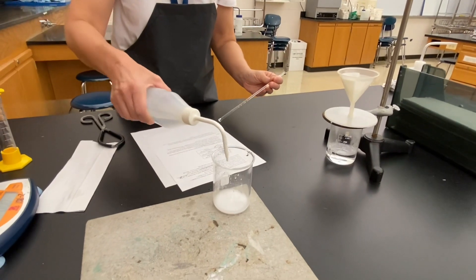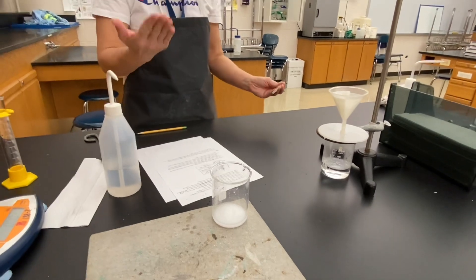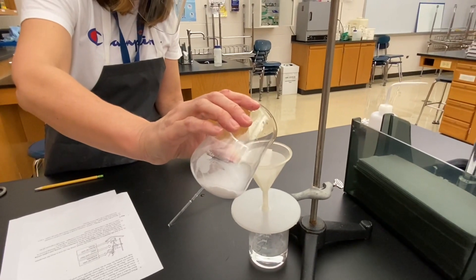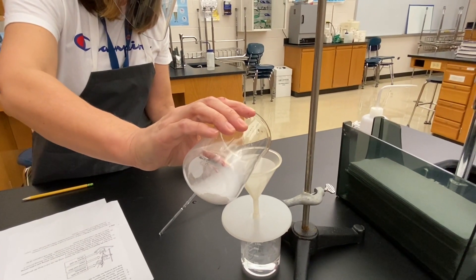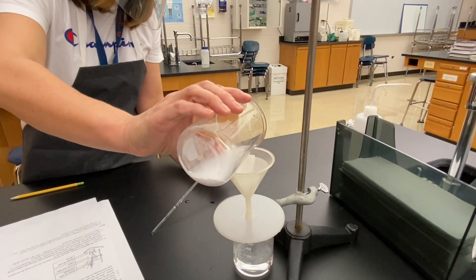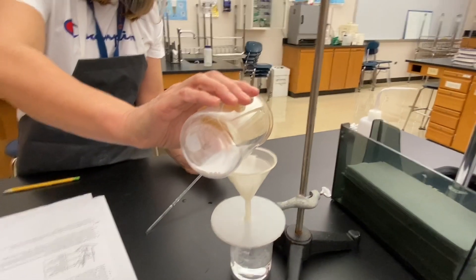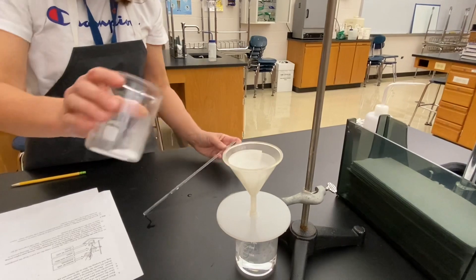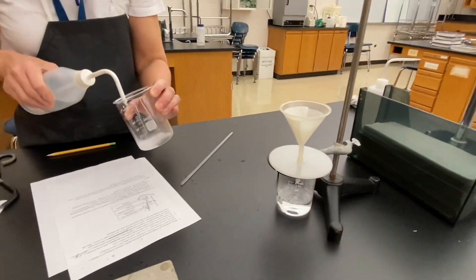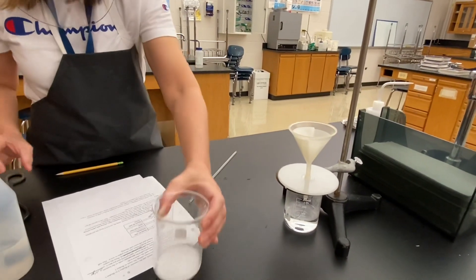Beaker one now contains just our precipitate, so none of the soluble product remains in there. I did a rinse with distilled water and want to filter that as well. In case I lose any of the solid, the filter paper will catch that precipitate. I'll do one more rinse and let that settle for a moment.